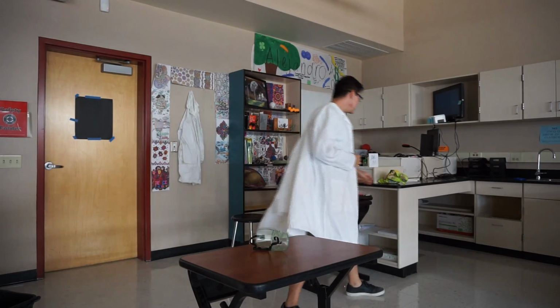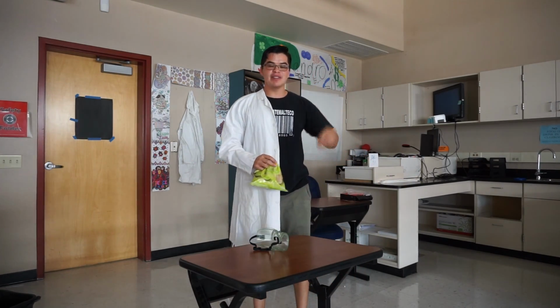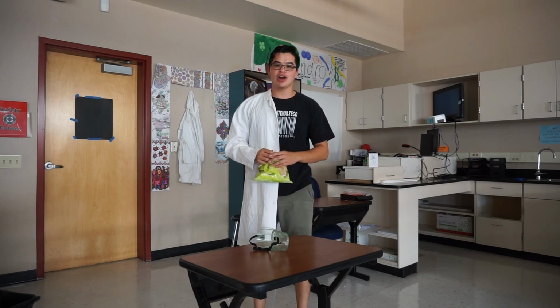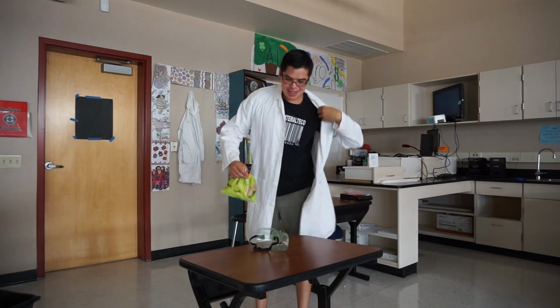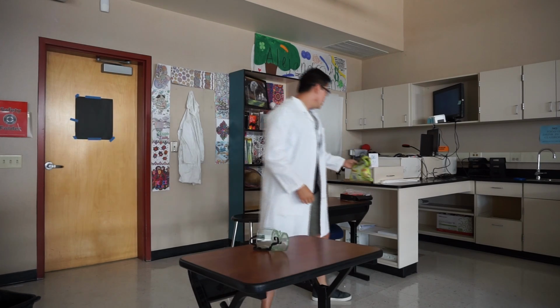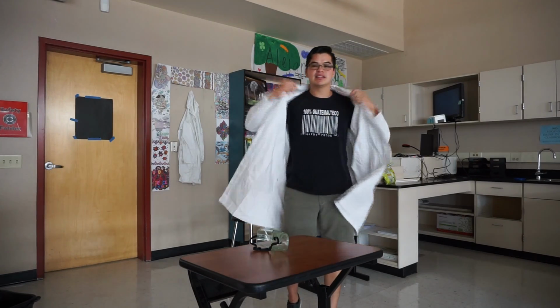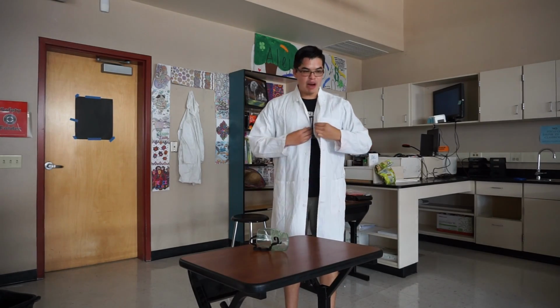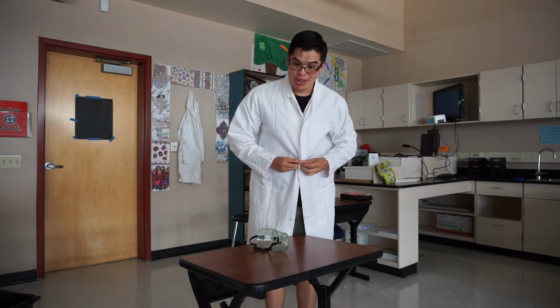So, our photosynthesis lab is going to help us see the effect that light has on carbon consumption in the process of photosynthesis. As humans, we can easily get our food from things like Lay's potato chips, right? But plants need to undergo photosynthesis in order to get their energy. So, how are we going to test the effect that light has on the consumption of carbon dioxide? That's a really great question.